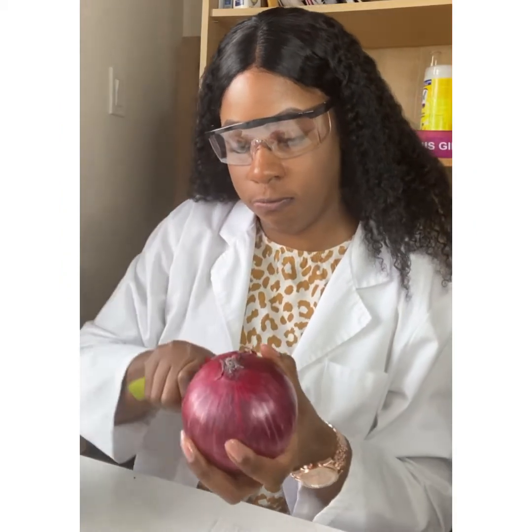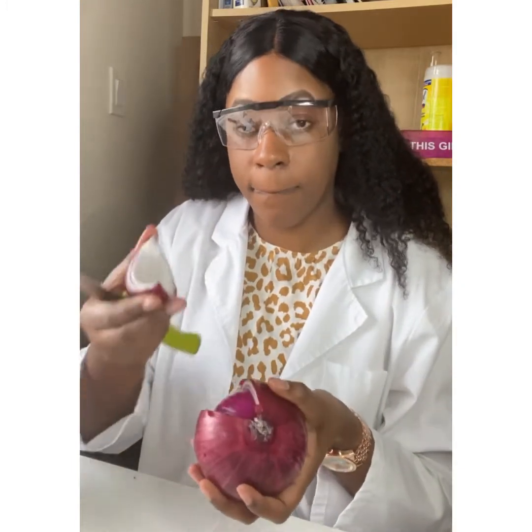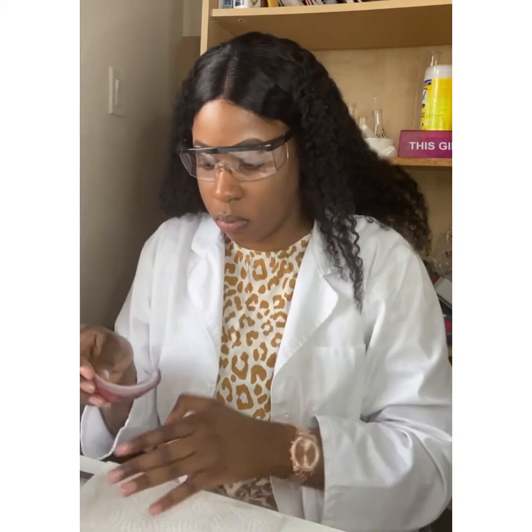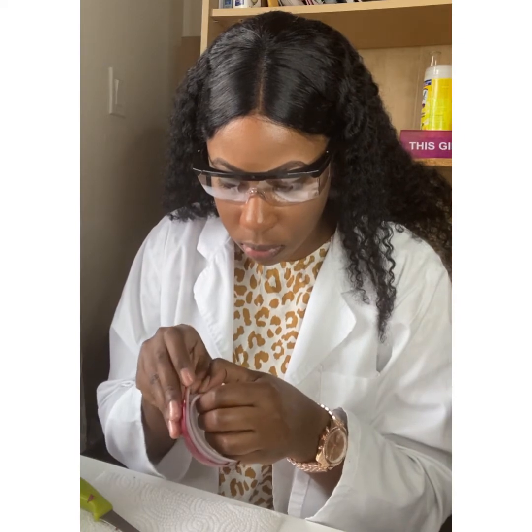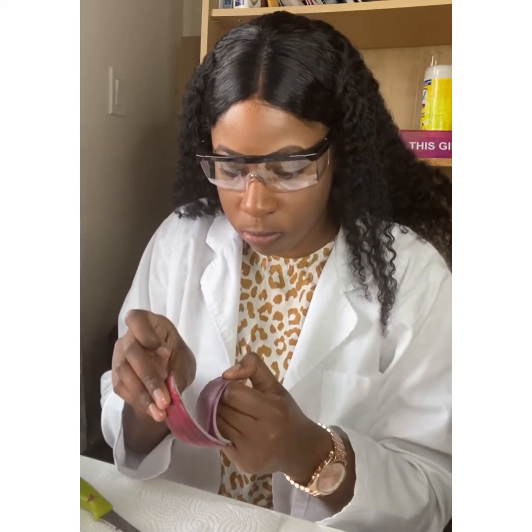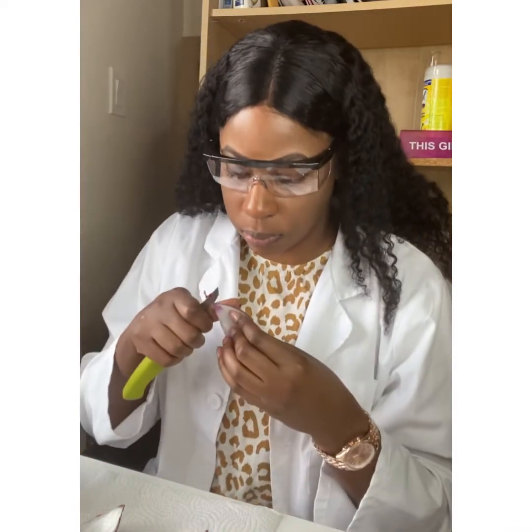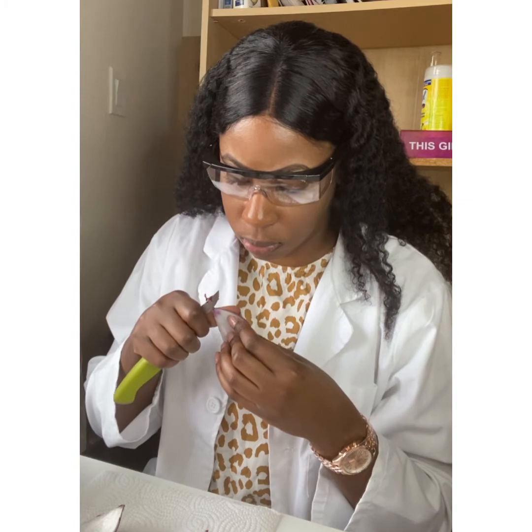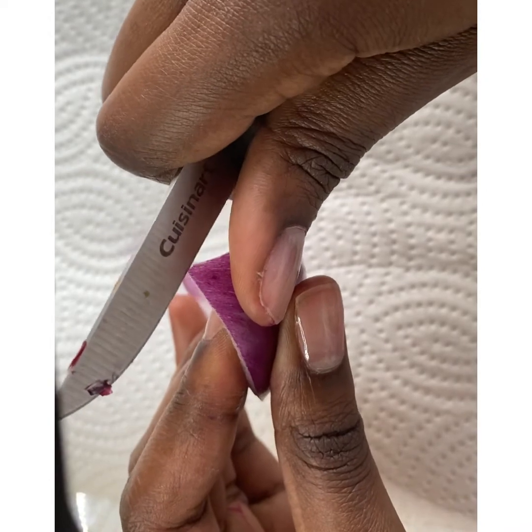The first thing I'm going to do is peel off the outer scales from my red onion. Then I'm going to cut into the onion to remove two small leaf tissues, separating them and removing that epidermal sheet. That's the piece of leaf that I need for this experiment. Now I'm going to use my knife to remove a thin slice of this epidermal layer from the red part of the onion.